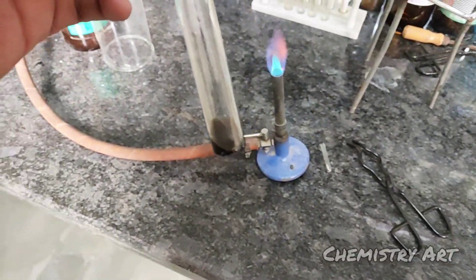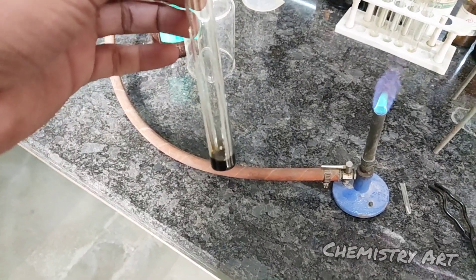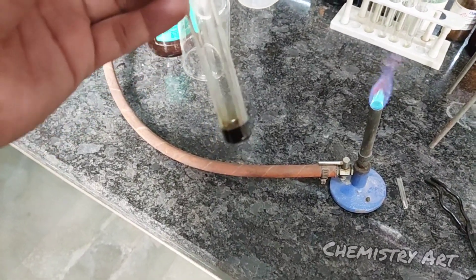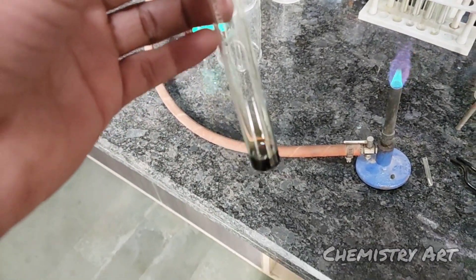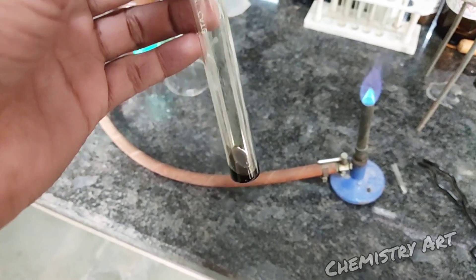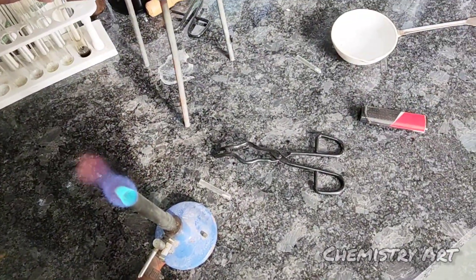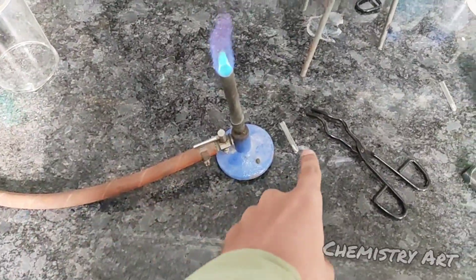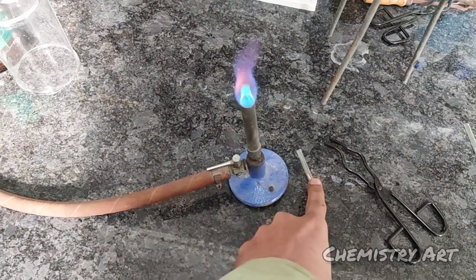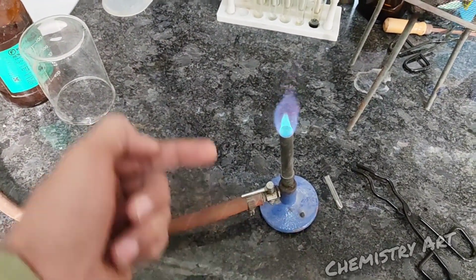In this compound I need to find out which extra element is there — chlorine, bromine, iodine, or any other halogen, or if nitrogen or sulphur is present. We need to add a few drops since this is a liquid compound. If it is solid, you need just one crystal. Remember, you must add it when the fusion tube is heated red hot.